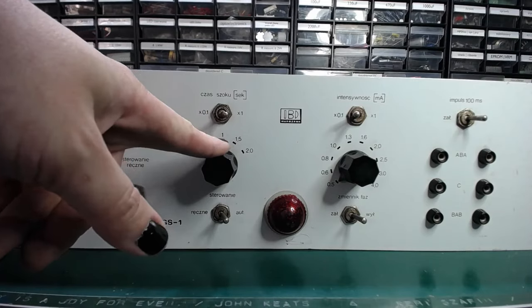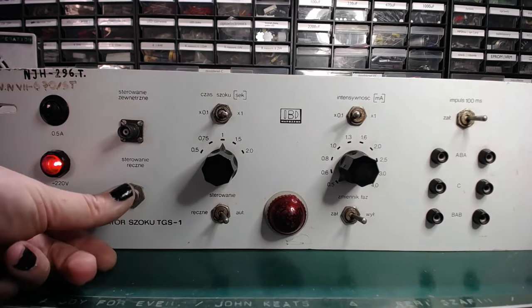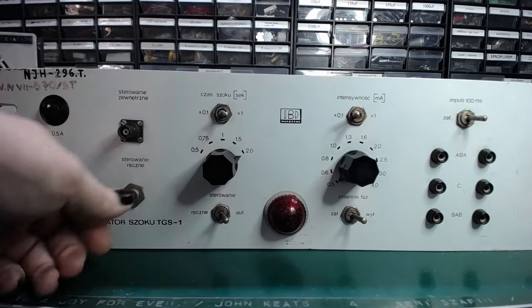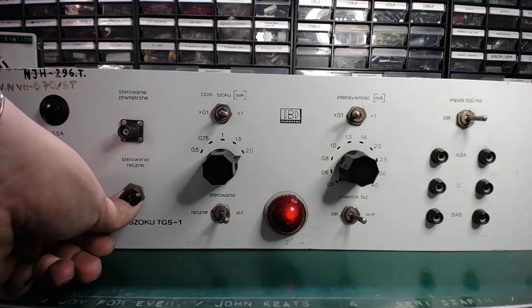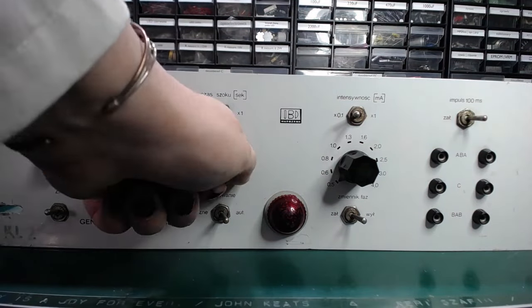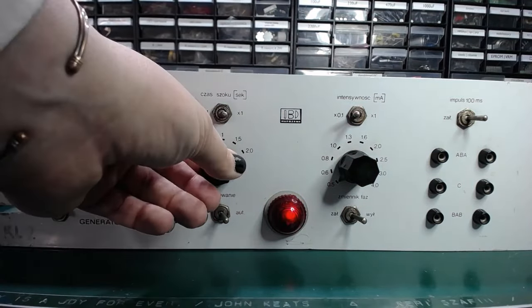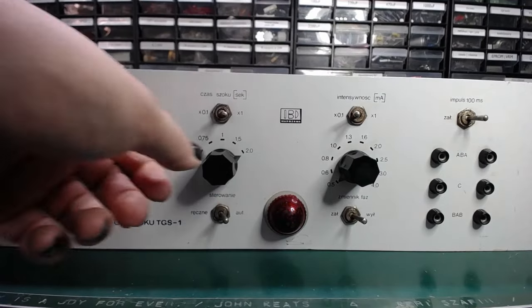Now if I change it to one, the initial hold off time is shorter, but the duration is even longer. And this should be the proper 2 seconds. But I think that this is way longer. This is decided by the RC time constant. But I discovered one more thing about this switch. If I go off the marked position, it applies the shock current constantly.